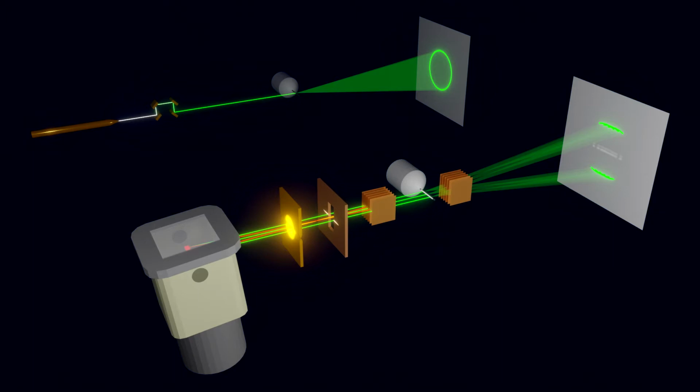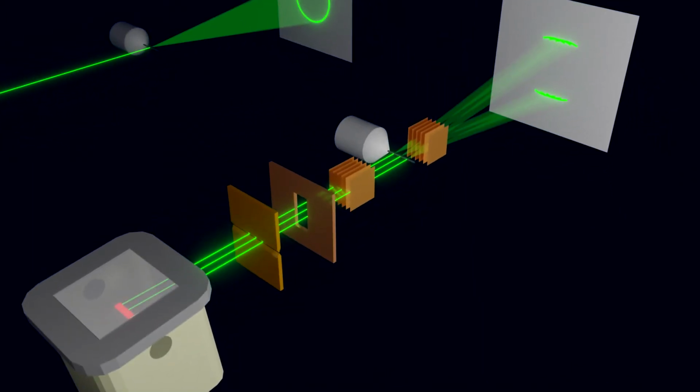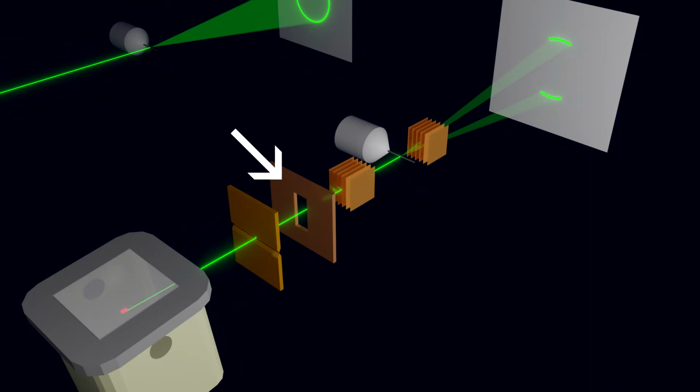Now let's try to modify this setup to mimic the diffraction signal we get from the synchrotron image plate as closely as possible. Note that it is irrelevant that the actual configuration has nothing to do with the synchrotron setup. We just want to fake a configuration that generates a similar signal on the detector. To obtain a narrow and parallel primary beam, we first reduce the width of the target, which is also called the focus, to the diameter of the beam. Then we also reduce the height of the divergence slit and the width of the beam mask to the same value. Now we already have a mostly parallel narrow beam profile.